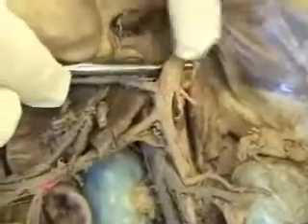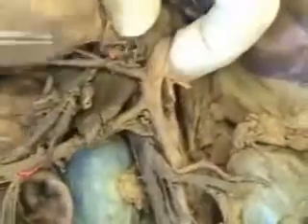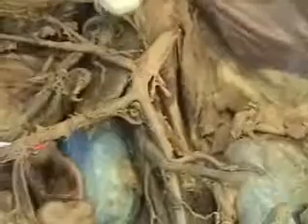As the aortic arch bends down, it becomes known as the thoracic aorta as it descends down through the chest. The thoracic aorta goes through this diaphragm muscle, and it comes out into the abdominal cavity. And here, not real bright red in this cat, but very obvious because of its size, this is the abdominal aorta. There are three major arteries branching off the abdominal aorta that supply the digestive tract.